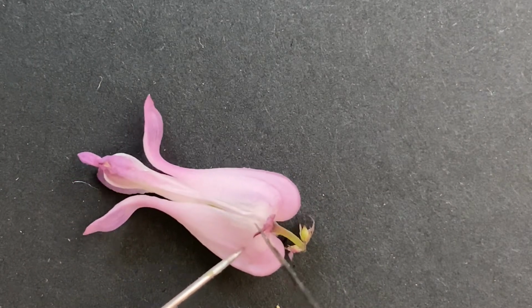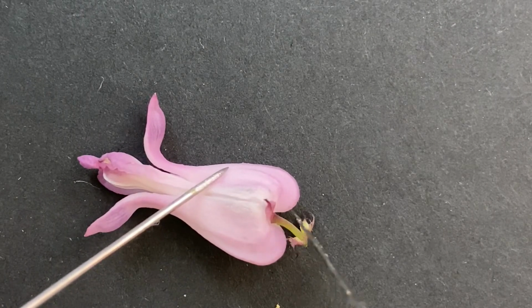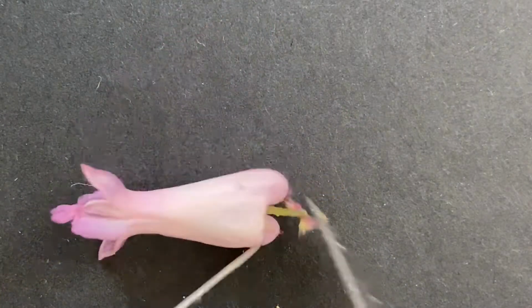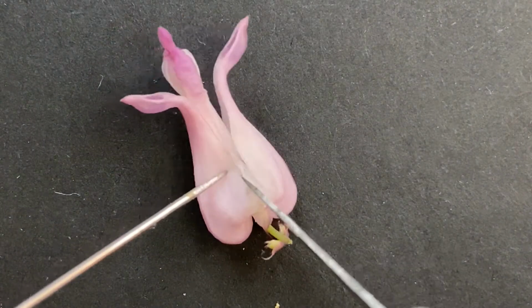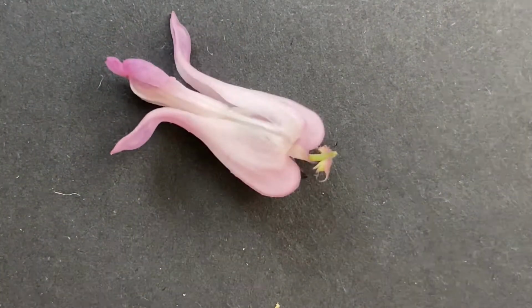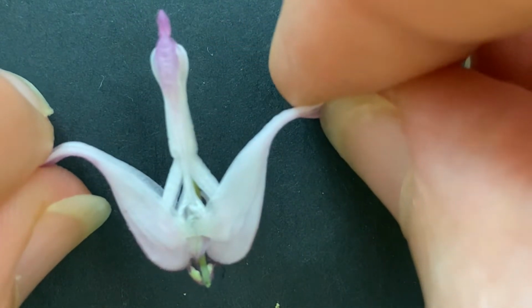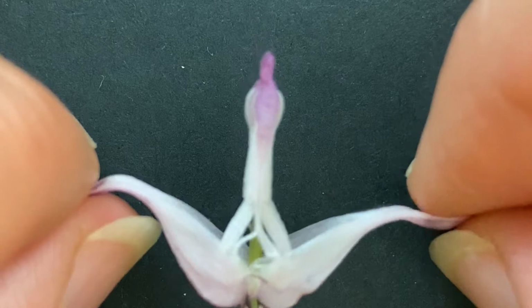So look at this bract. See how dark it is? There it is right here on the top. This bract. And then there's going to be another one on the other side over here. And then we'll see if we can slice into this guy. Might be easier. Oh look, that's almost a little lady in the bath form. So as it opens up, you start to see that green ovary in there.